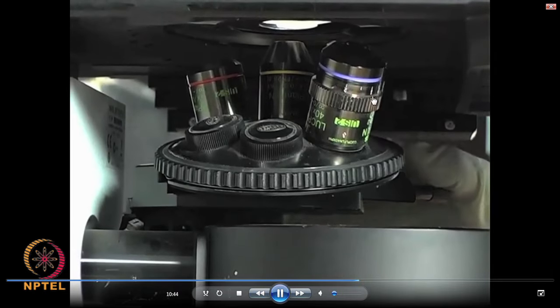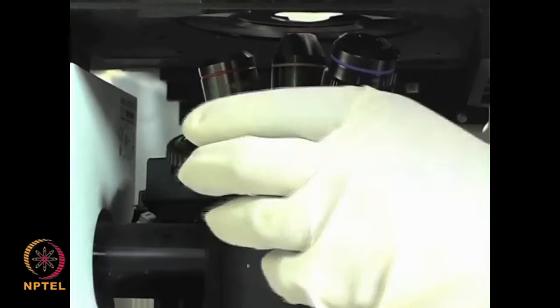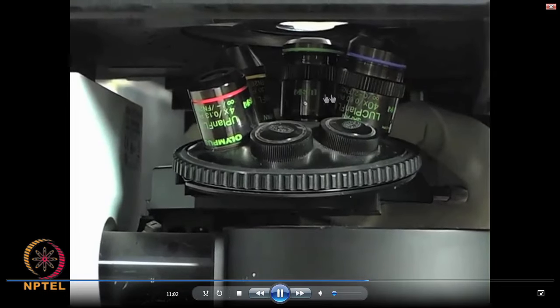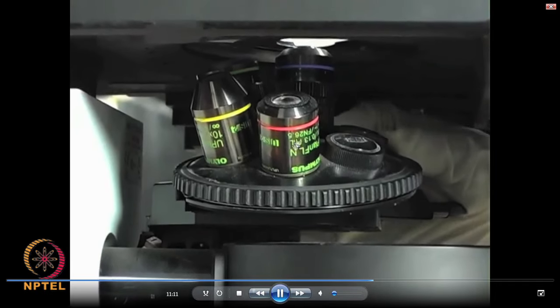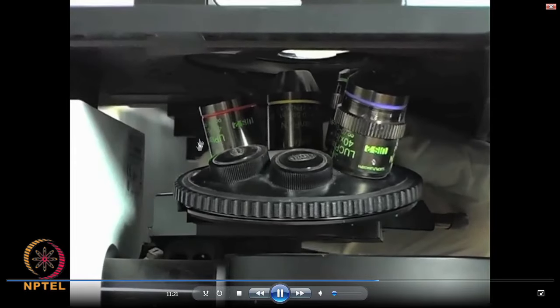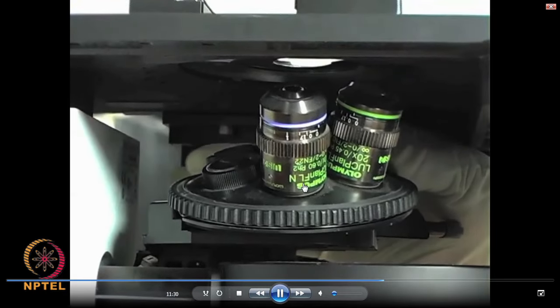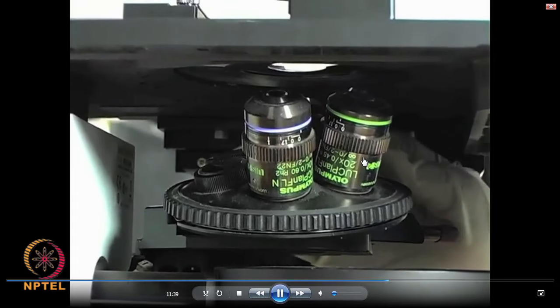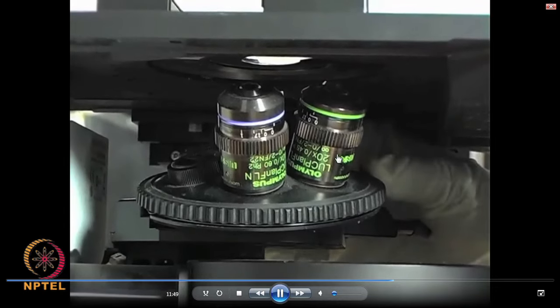You see that all your objectives are kept in the vertical position, compared to the normal vertical type metallurgical microscope — it is put in an inverted position. You can see that there are about 6 slots: 2 slots are kept empty but the other 4 slots are filled with different kinds of objectives. You can also see that the details of the objectives — magnification 4x, 10x, 20x, and 40x or 50x — are written on them. Depending upon the kind of microscope, you can have 4, 5, or up to 6 objectives.